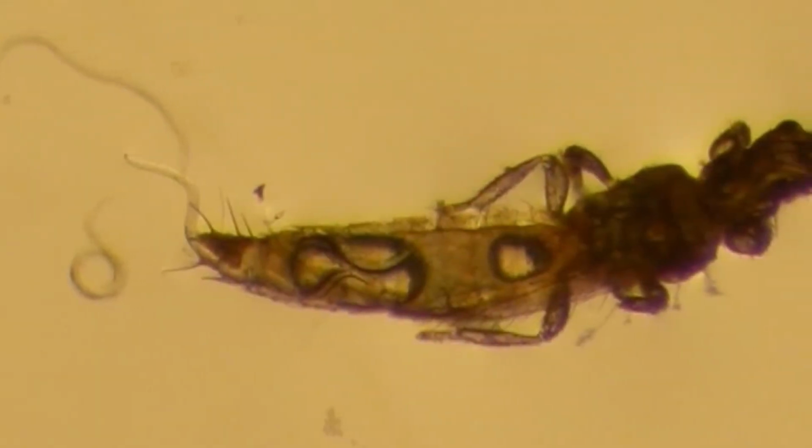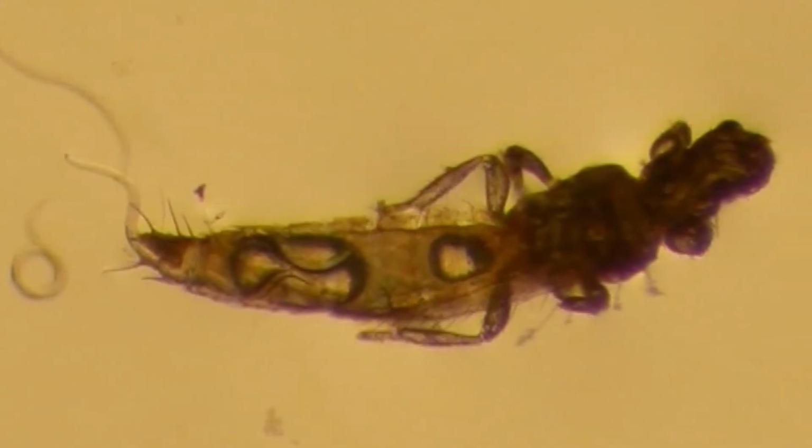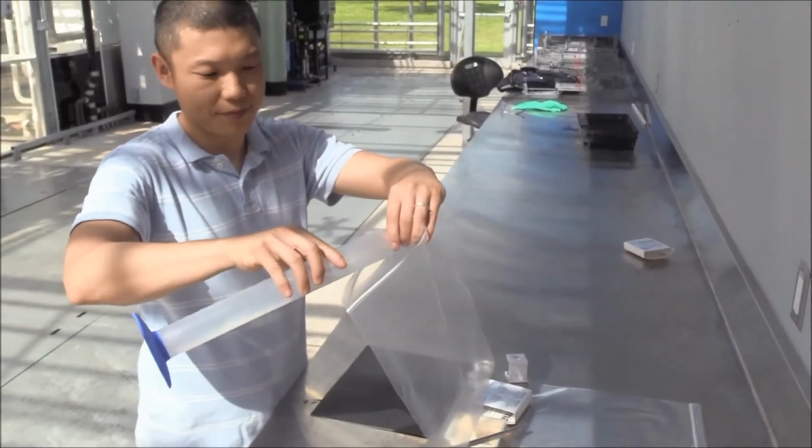To be able to locate and infect thrips, they have to be alive and healthy. Dead nematodes will not kill anything. To know if the product you are going to use is viable, or to check if passage through your application equipment has not damaged the nematodes, you can do a simple test.